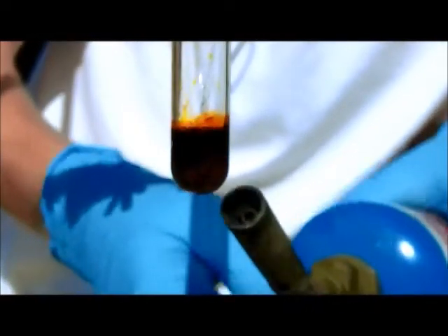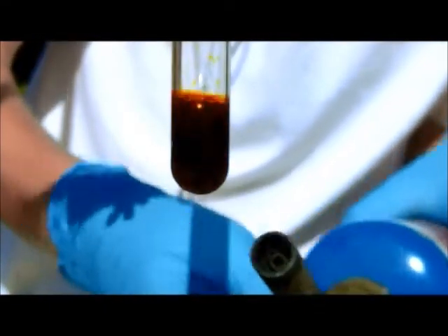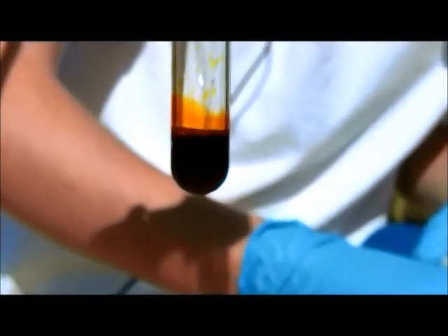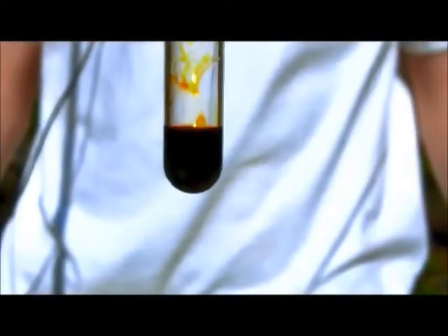Alright, continue to gently heat this until everything dissolves. Now that heating is done, we can see that we're left with this really dark, almost black liquid. Go ahead and let that cool down, and potassium trichromate will crystallize out.